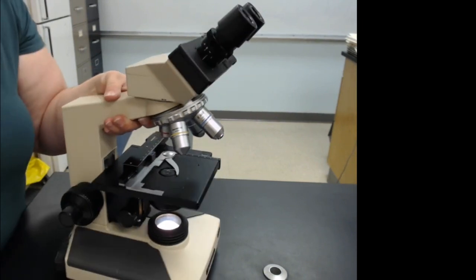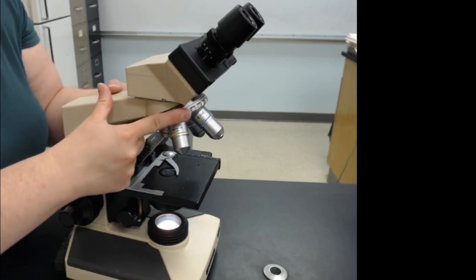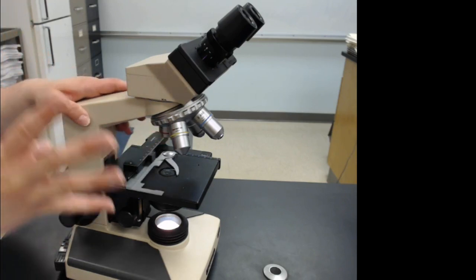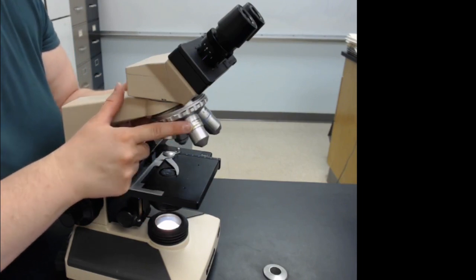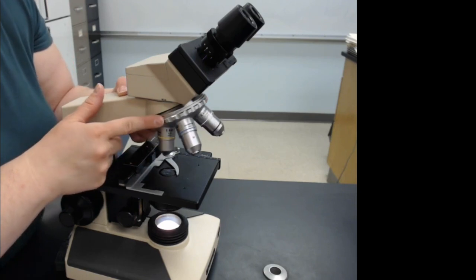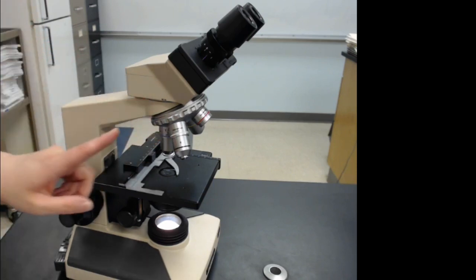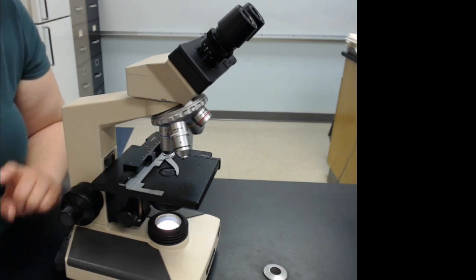The arm supports the nosepiece, which is a rotating ring that contains the objective lenses. There are four objectives on all of these microscopes: a 4x objective in red, a 10x in yellow, a 40x in blue, and a 100x in white. We do not use the 100x in class.